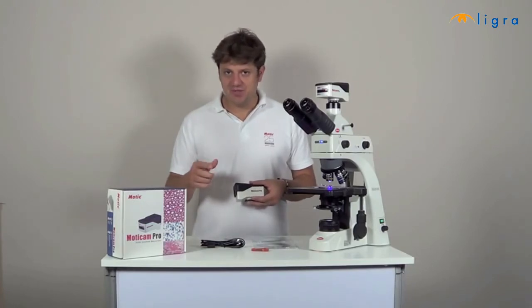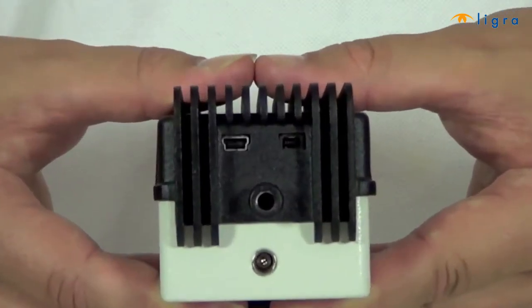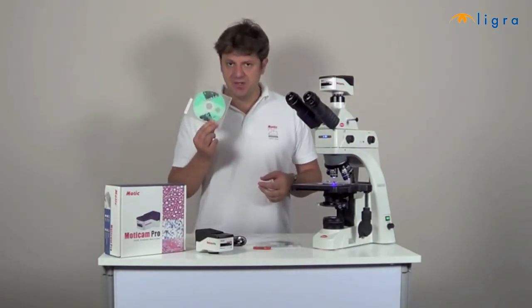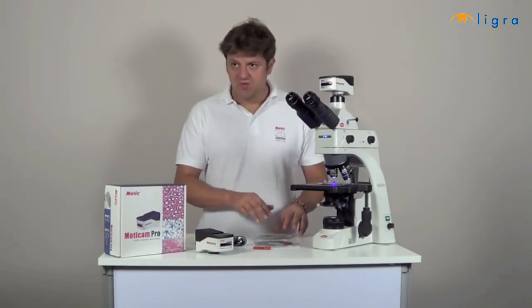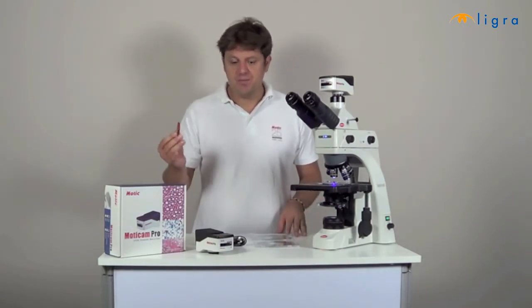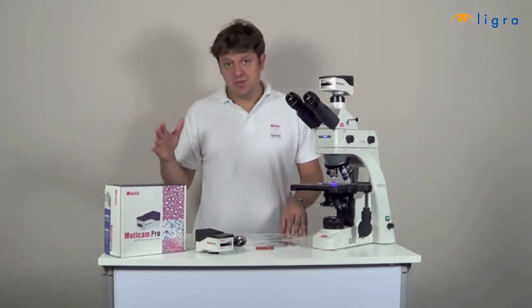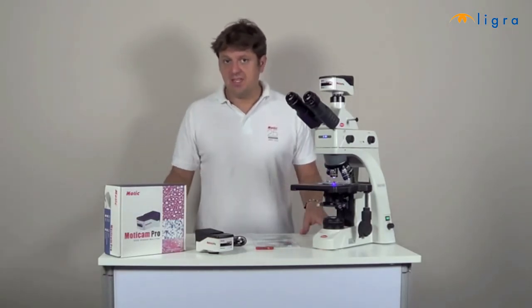All cameras are connected to the computer with a USB cable, and there is a trigger port for capture control with an external device. All Moticam Pro cameras come with the software Motic Images Advanced 3.2 and also with the software Motic Images Plus 2.0. To work with the Advanced 3.2 software, you need this dongle or a key, which is included in the package, and without this dongle the software would block. And just as with Moticam cameras, all Moticam Pro are compatible with other software using the universal drivers Twain and DirectShow, and also the SDK software is available to program the camera yourself.